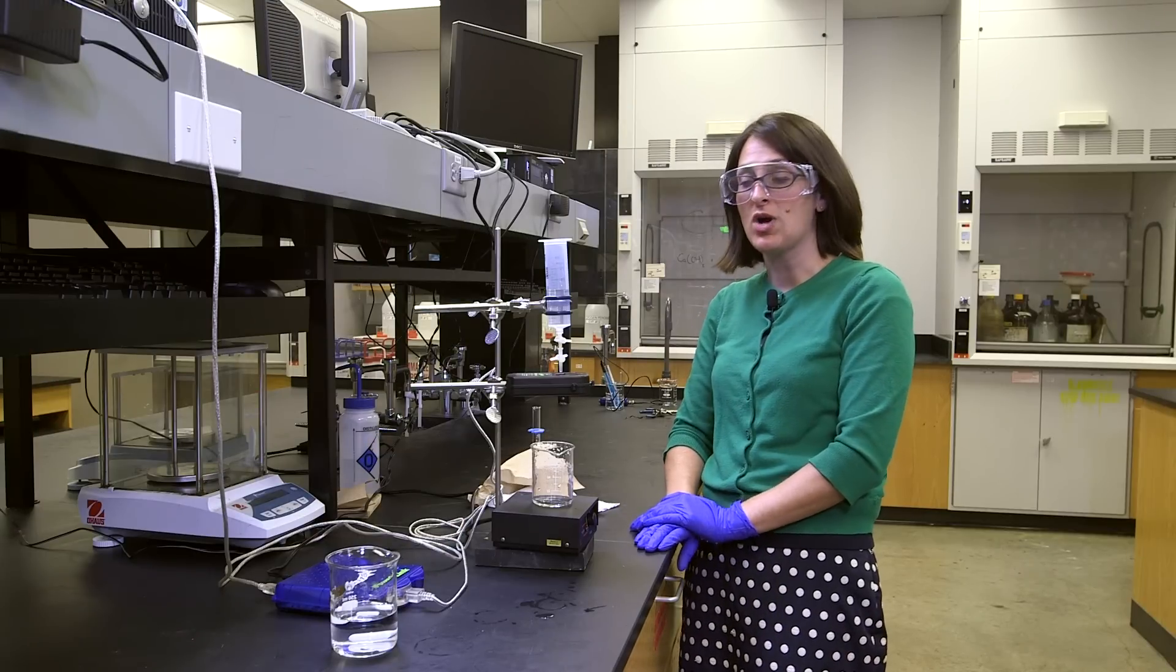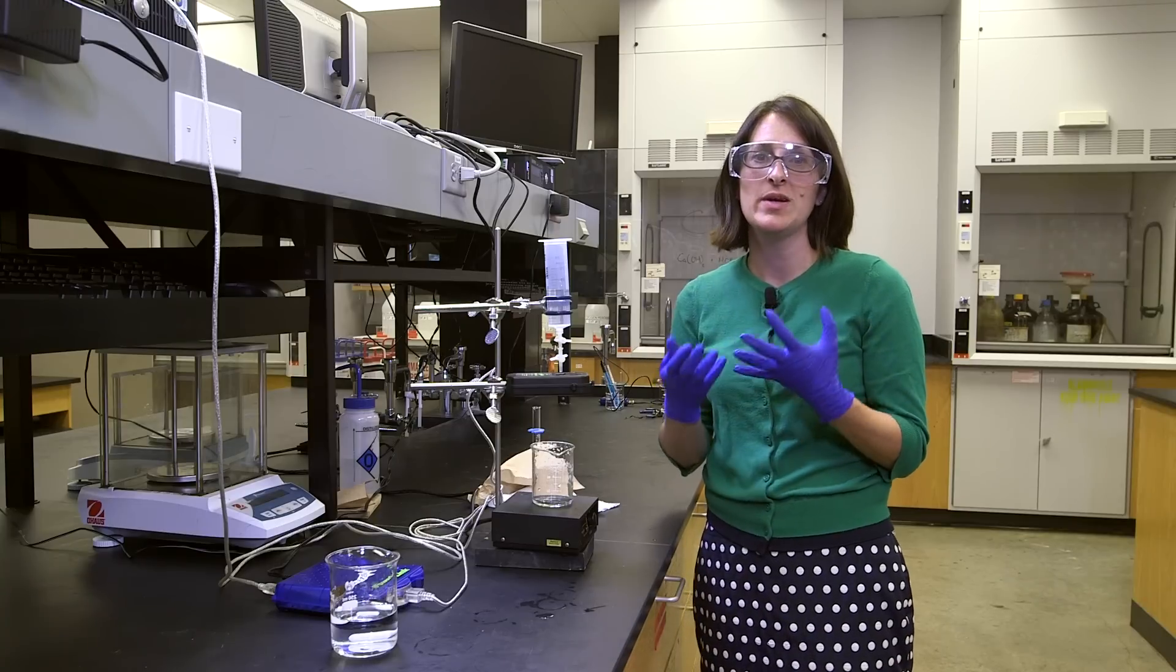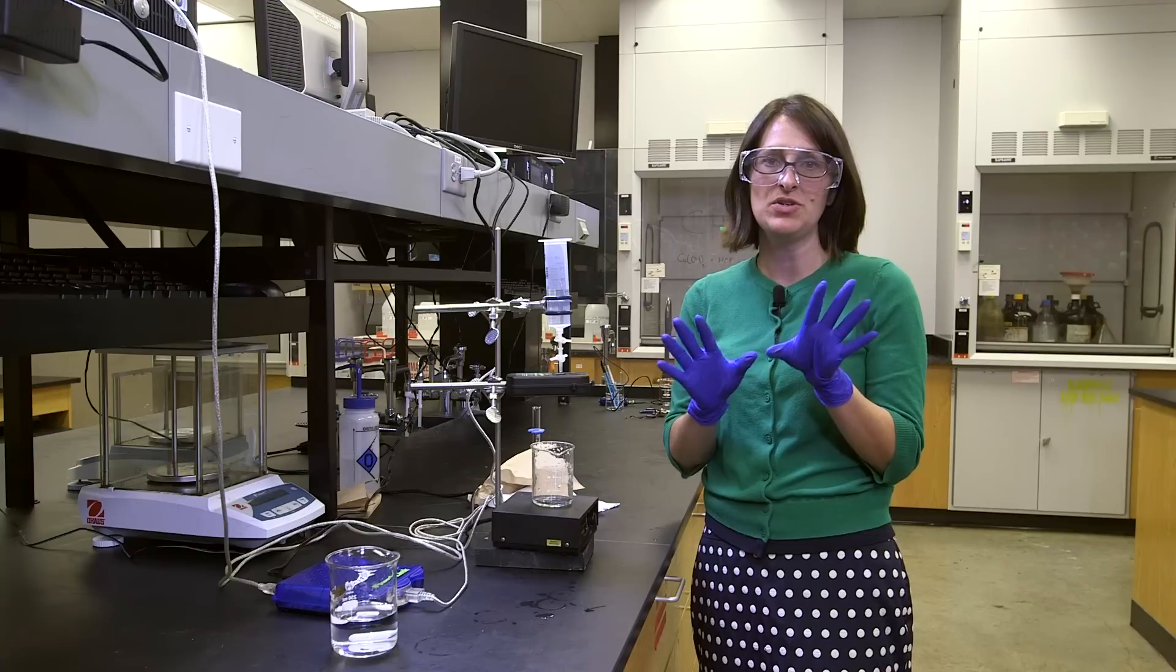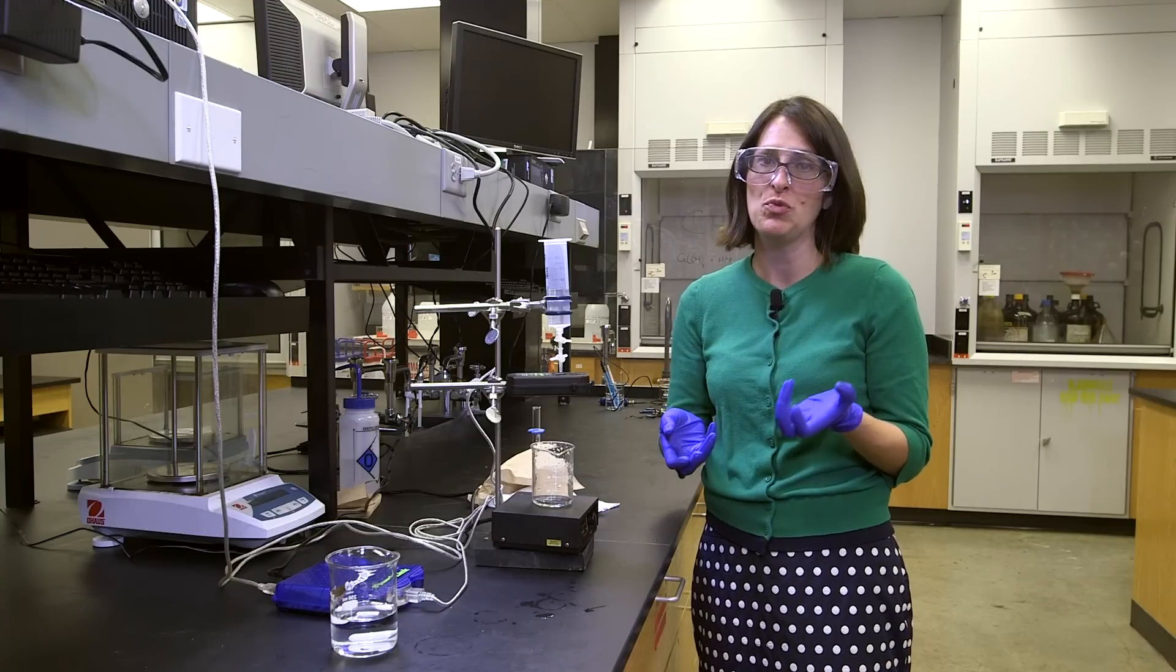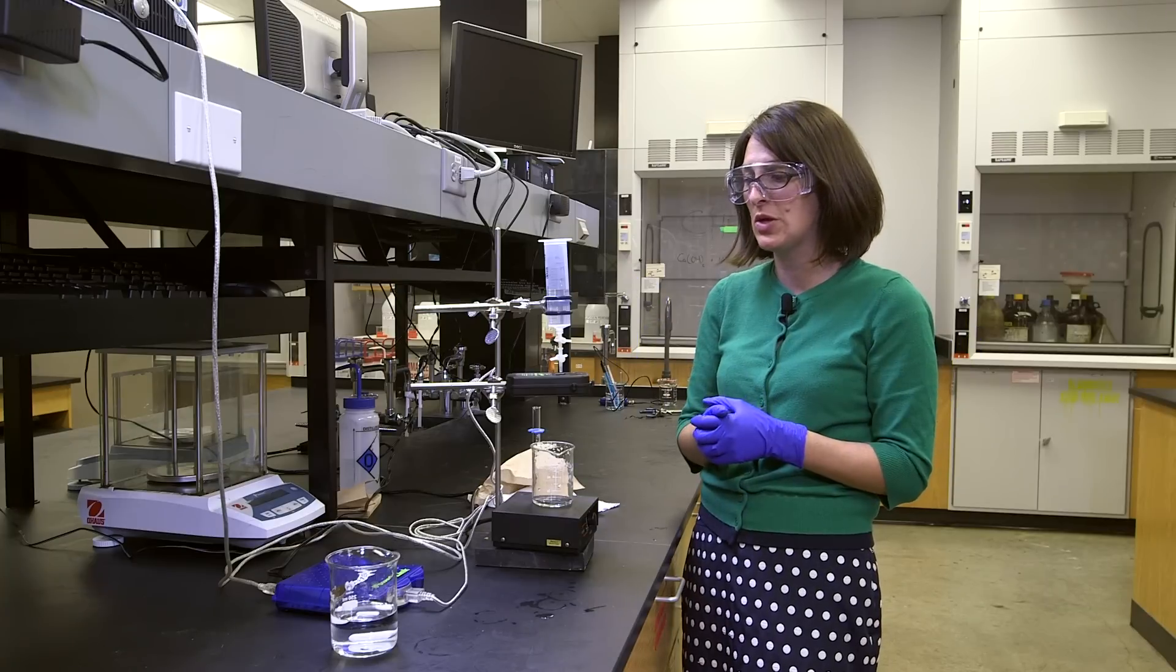A number of labs are going to use a drop counter. Before I start talking about that, always, always, always, we have on our nitrile gloves and our safety glasses and wearing the appropriate attire for lab, closed-toed shoes and no big bulky flowing clothing items.